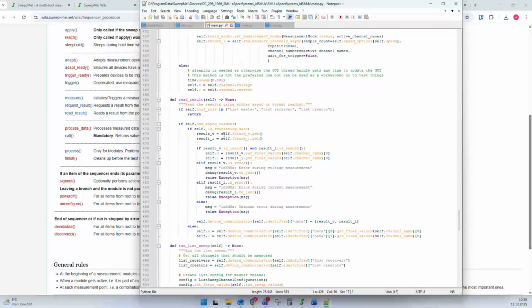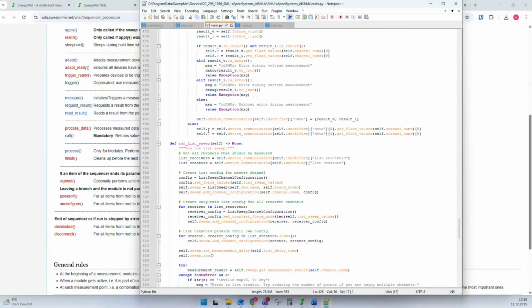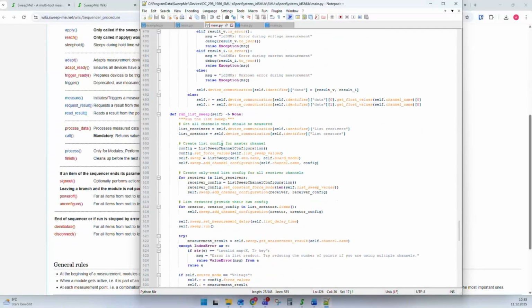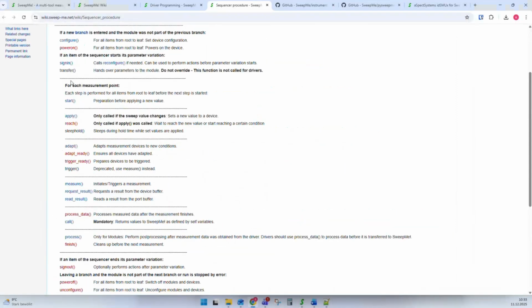And in read result, we can retrieve the data and save it, for example, to an object like self.v and self.i for voltage and current. And at some point, we have this call function, and call now returns a list of voltage and current as we have defined it at the start of this driver. So this is one measurement point. And whenever SweepMe goes to new set values and you make sweeps, it will run through all these functions again and again and takes data for all the instruments whenever they have these functions applied or used.